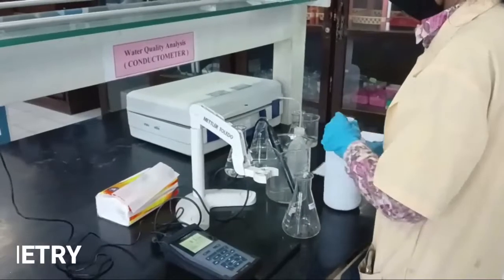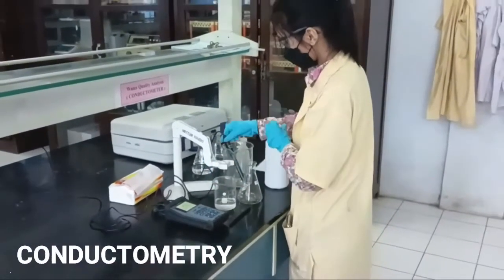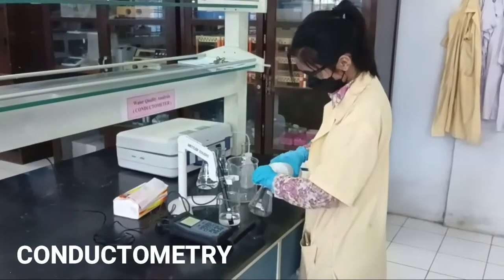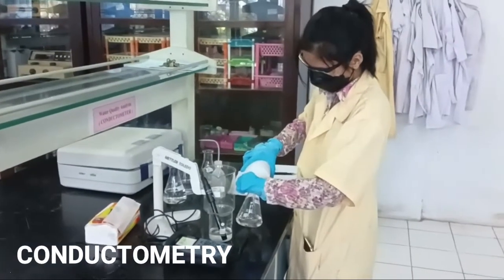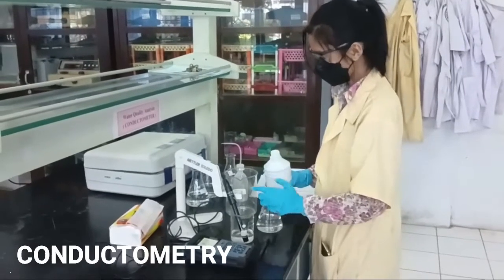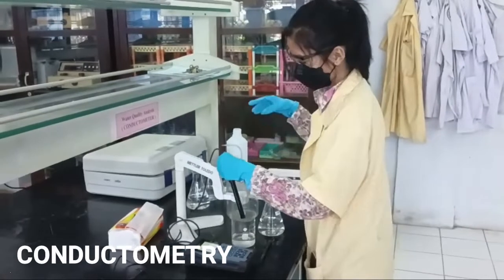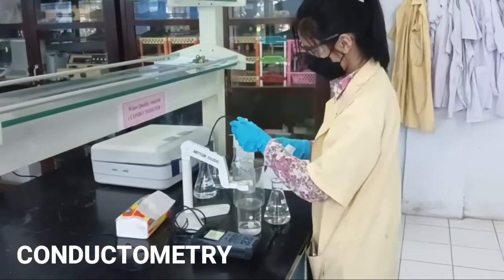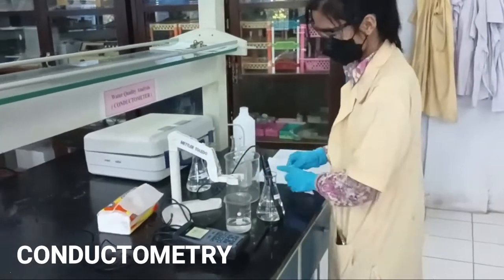In conductometry experiments, students are expected to be skilled in using a conductometer to determine the electrical conductivity of a solution that is acidic or basic, including water quality testing. In addition, students are also expected to be skilled in titration using a conductometer titration tool. This experiment supports analytical chemistry, instrumental chemistry, environmental chemistry, and advanced chemistry courses.